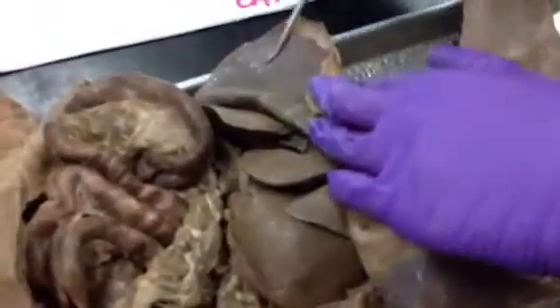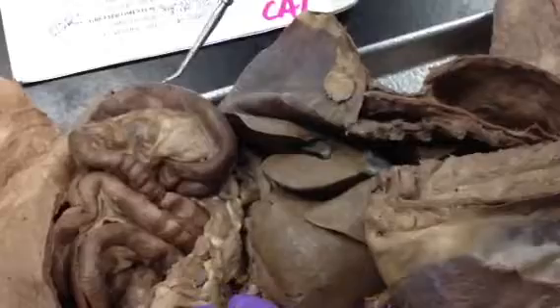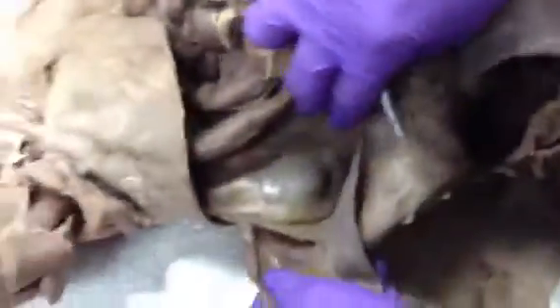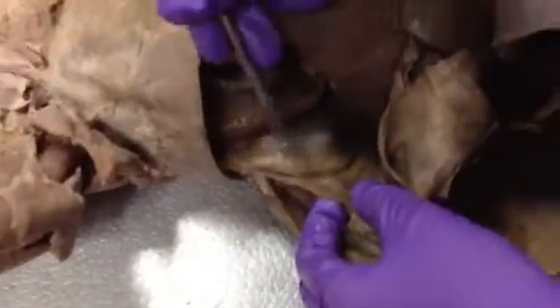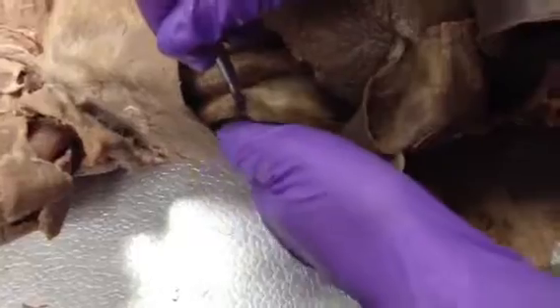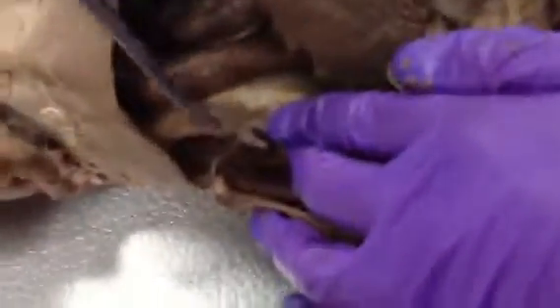So when you open up the peritoneal cavity, this layer of serosa is the parietal peritoneum. What covers the organs is the visceral peritoneum. The kidney is retroperitoneal. So when you look on this side of mine, you can see this is the parietal peritoneum, and you can see that it's not on the dorsal side of the kidney. The kidney only has it on one part, so the kidney is retroperitoneal.